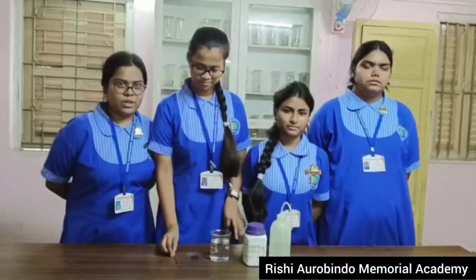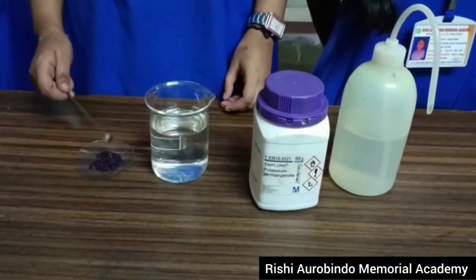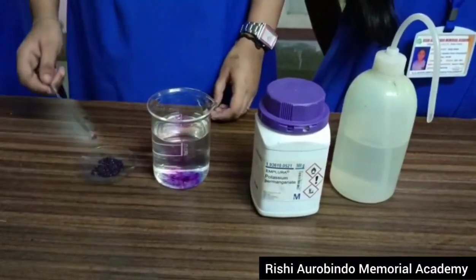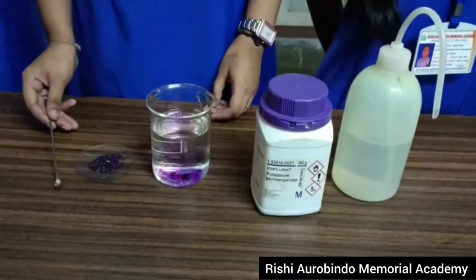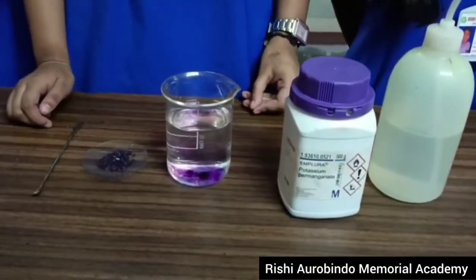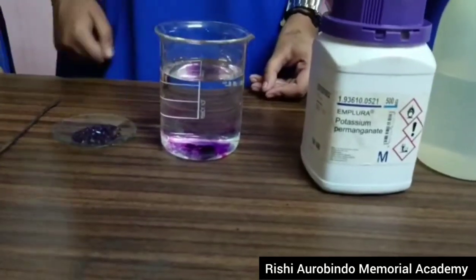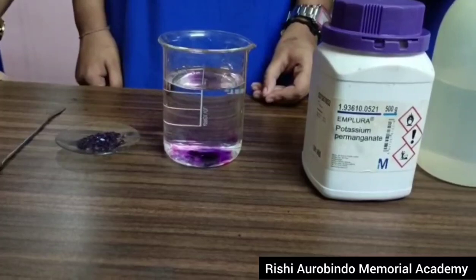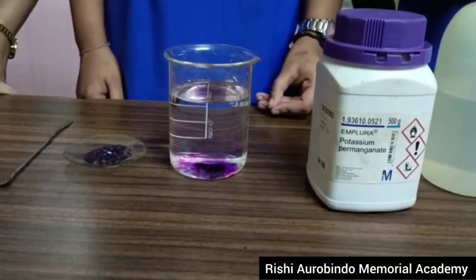Let us see the experiment. Now we are pouring a few crystals of potassium permanganate into the distilled water. We are using potassium permanganate because it gives a fine purple color and we can see the change in the solution. We see that the potassium permanganate is more concentrated at the bottom and the upper layers are still colorless.